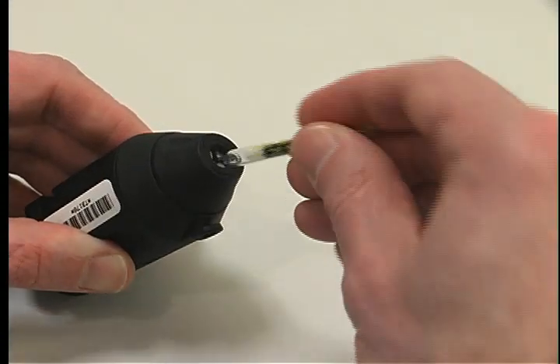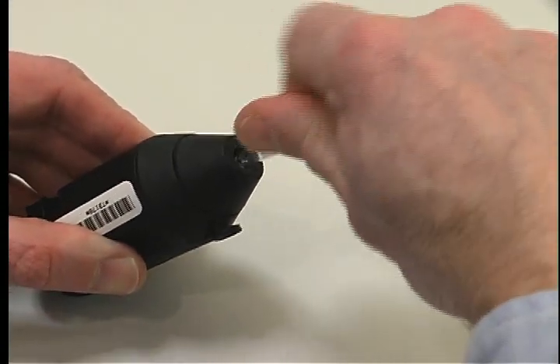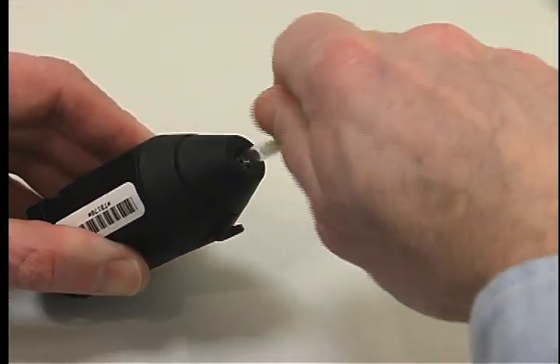Use a tube breaker to break both ends of the tube to provide an opening at least one half the internal diameter.